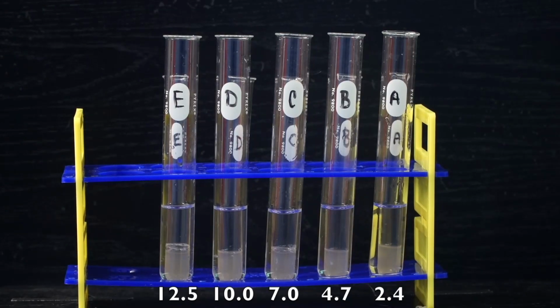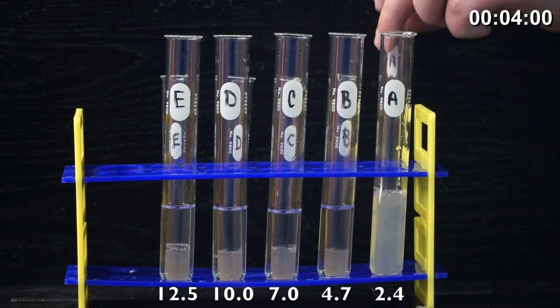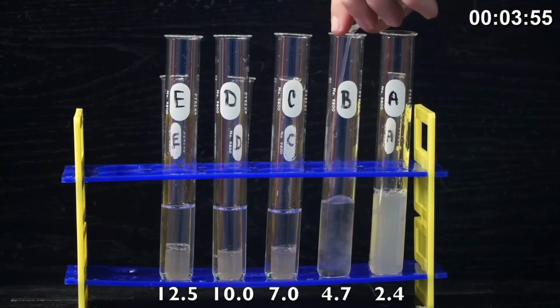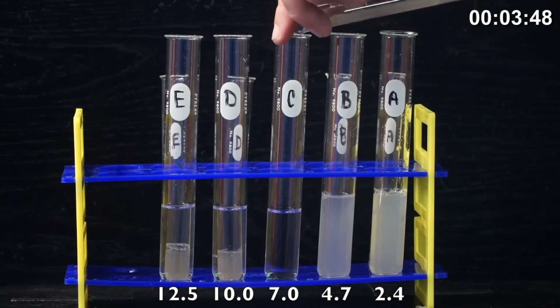All right, so we have our large and small test tube set up for the pH variable. Remember, this is our independent variable, and our dependent variable will be the actual amount of oxygen gas foam that is produced after 4 minutes. So we'll go ahead and add the contents of the small test tube, which is our catalase, into the large test tube. And then you want to do this as quickly as possible so that they have as similar of a starting rate.